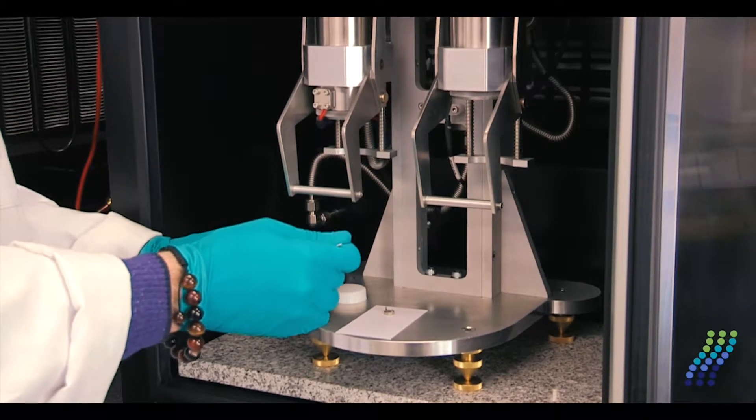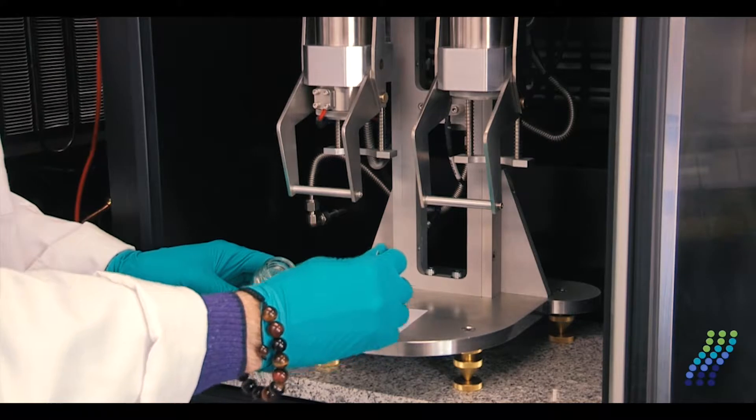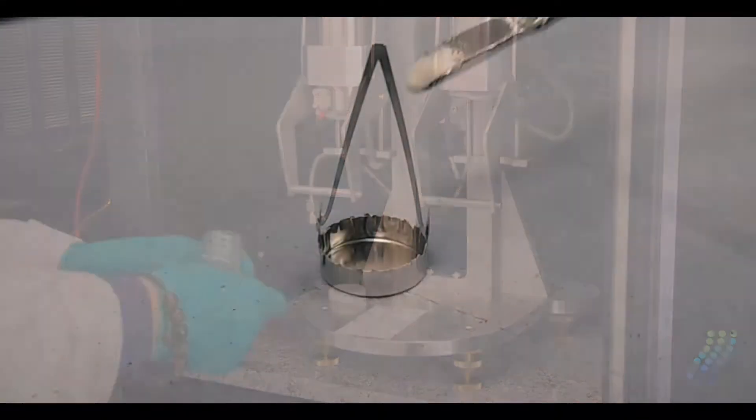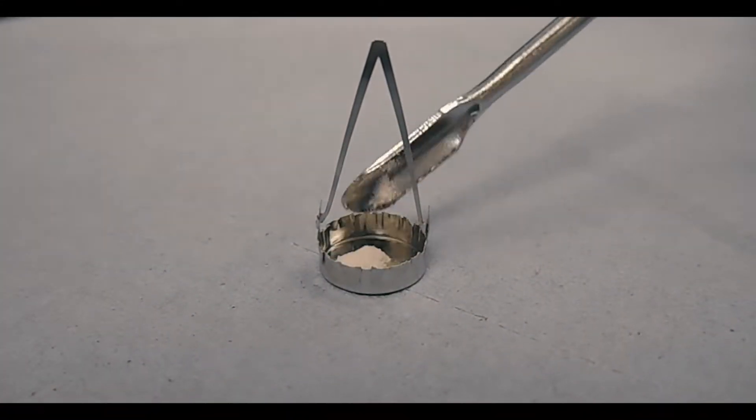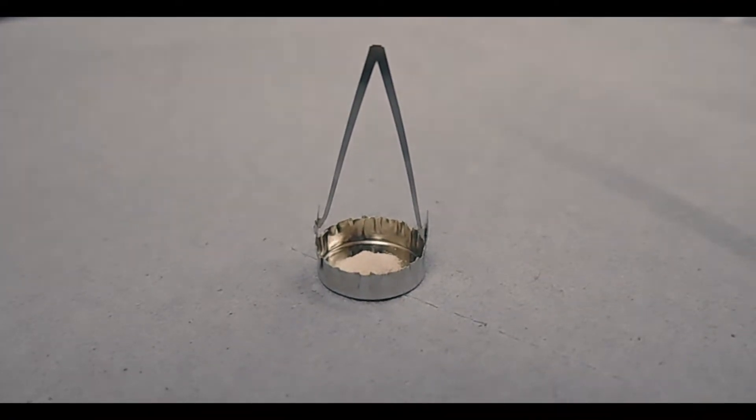The amount of mass I need depends on the type of sample. In this case I'm using Avicel. I know that the material has a very high uptake of water, so 5 to 10 milligrams of sample should be more than enough to give me very acceptable data.